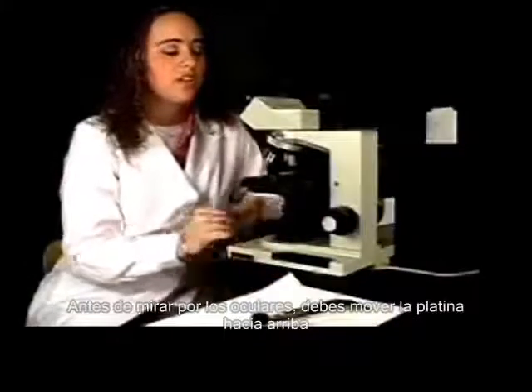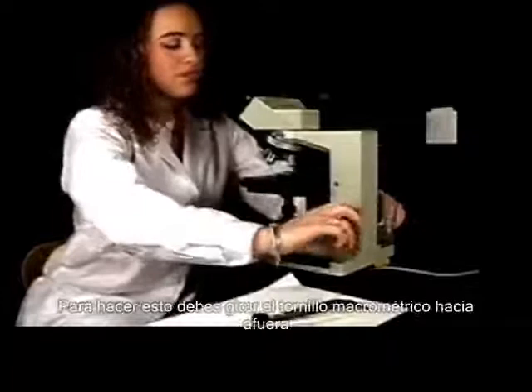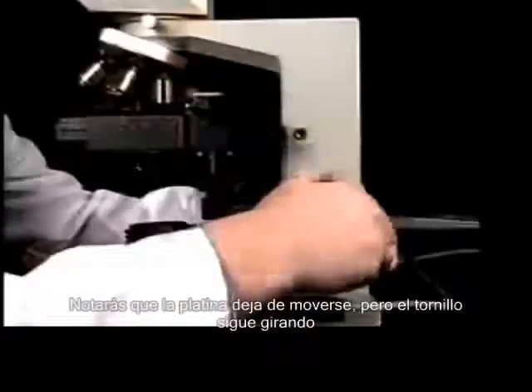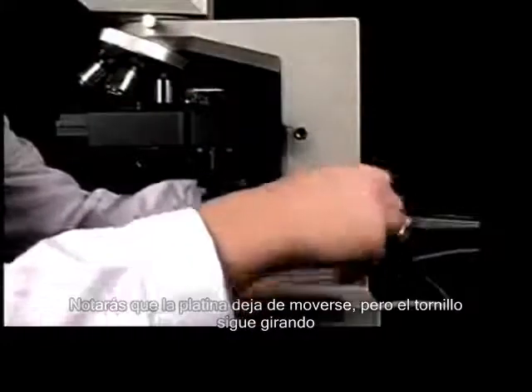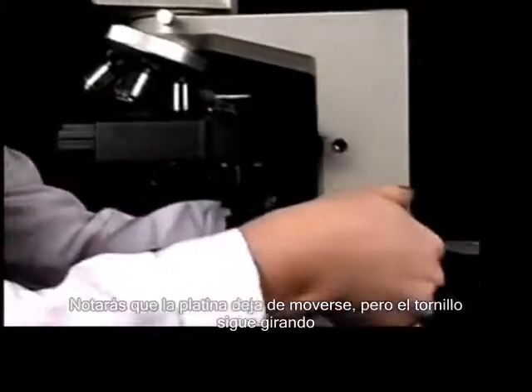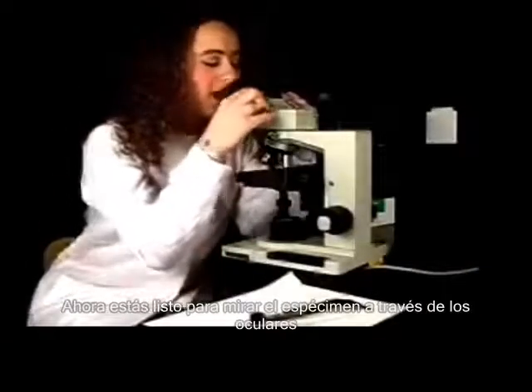Before looking through the oculars, you want to raise your stage all the way up. You would do this by turning the coarse focus knob away from you. You'll notice that the stage stops moving, but the coarse focus knob continues to turn. You are now ready to view the specimen through the oculars.